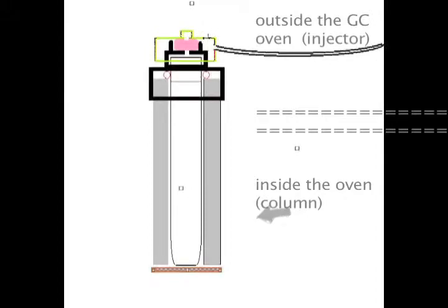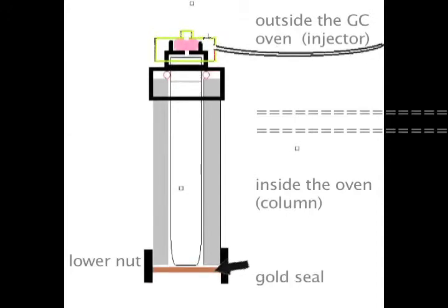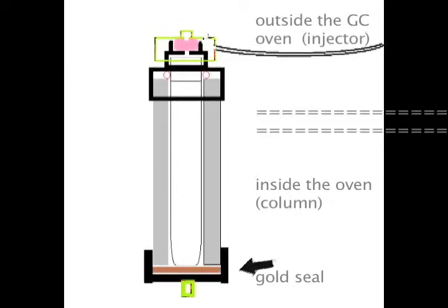The bottom, now this is inside of the oven, also has a nut. The nut is part of the seal. The seal is actually through a little gold plate and then a little gasket, but it's snugged up against the bottom. The port liner just sits on this plate, and the nut holds the seal and makes a seal. Then into this nut is yet another receiver which takes the column.